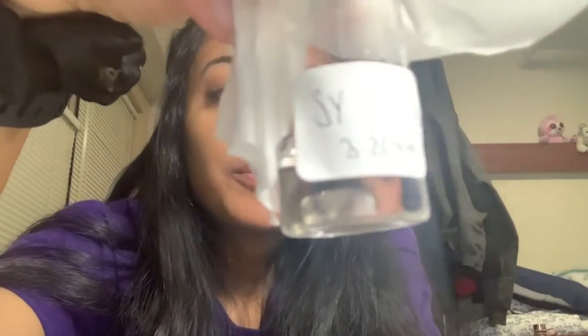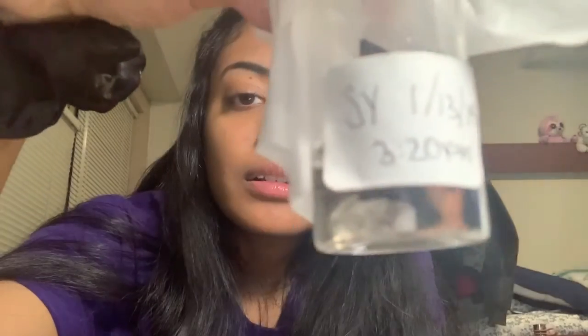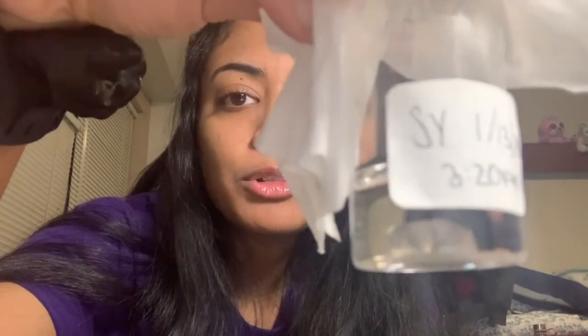I've continued to keep my vial in the same spot next to the window, and the temperature has been consistent inside the room, although it has gotten much colder outside. Yeah, this crystal may have just been a late bloomer of sorts.